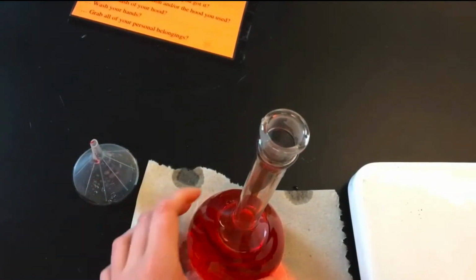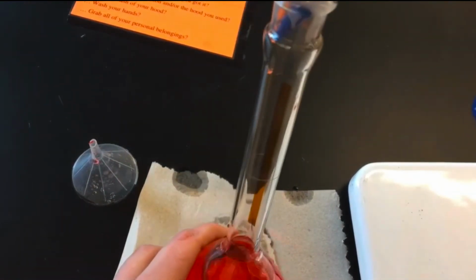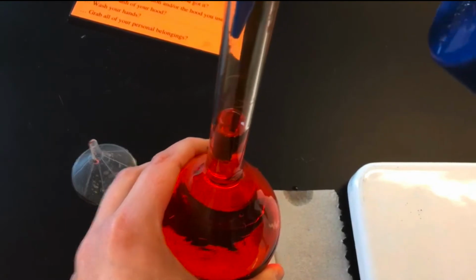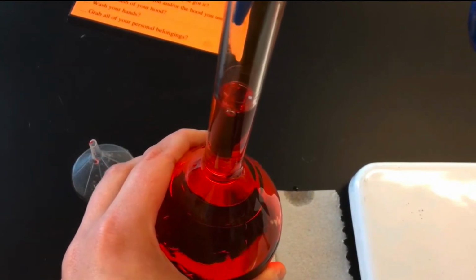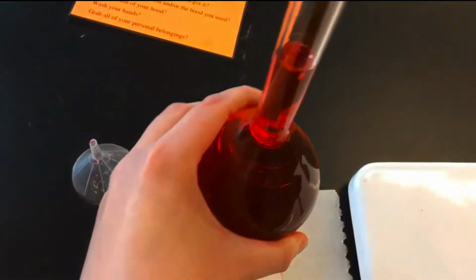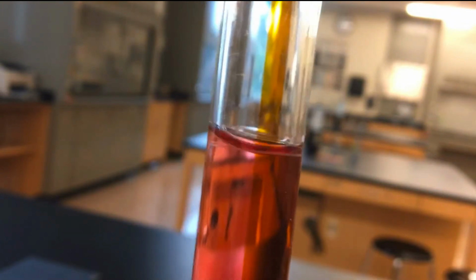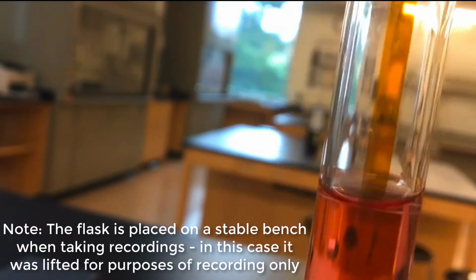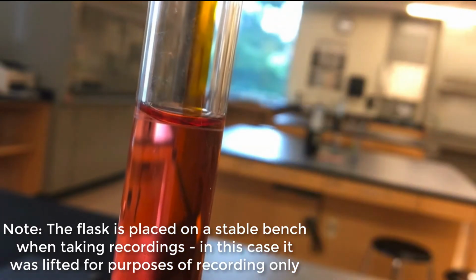I'm going to add the distilled water. I filled it up pretty full, but we're going to do the rest this way. You're going to want to fill, and we're getting close to the line, so we'll go very slowly. Ideally, we want the meniscus just to be touching the line, like here. Sorry, can't hold it still. As you can see, it is there.